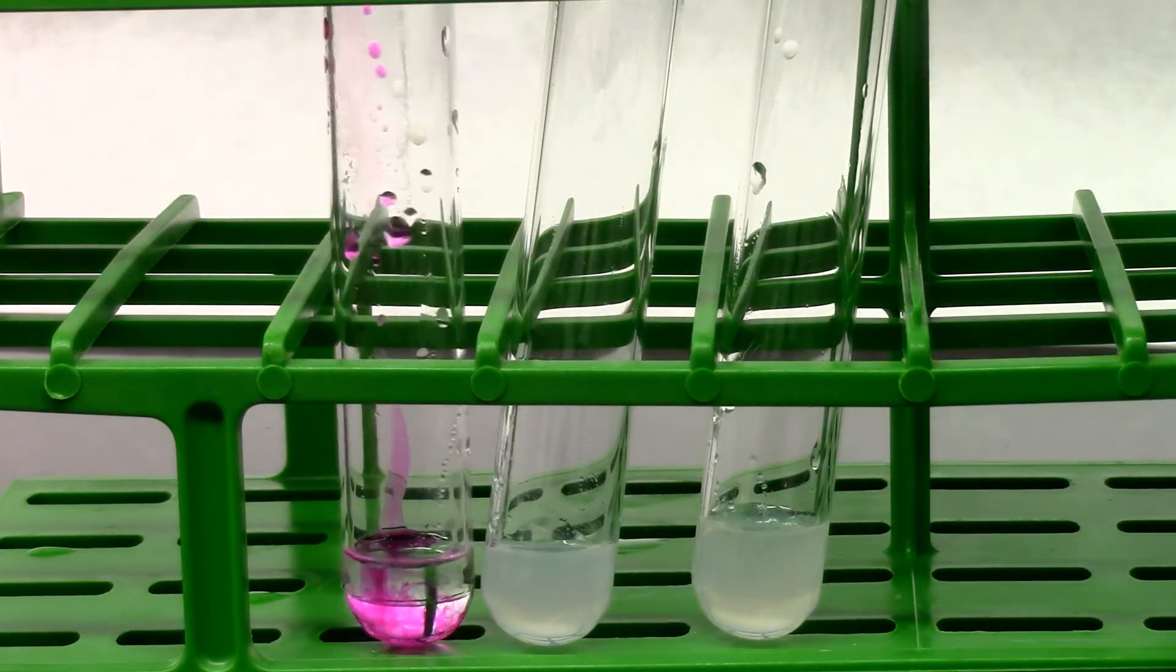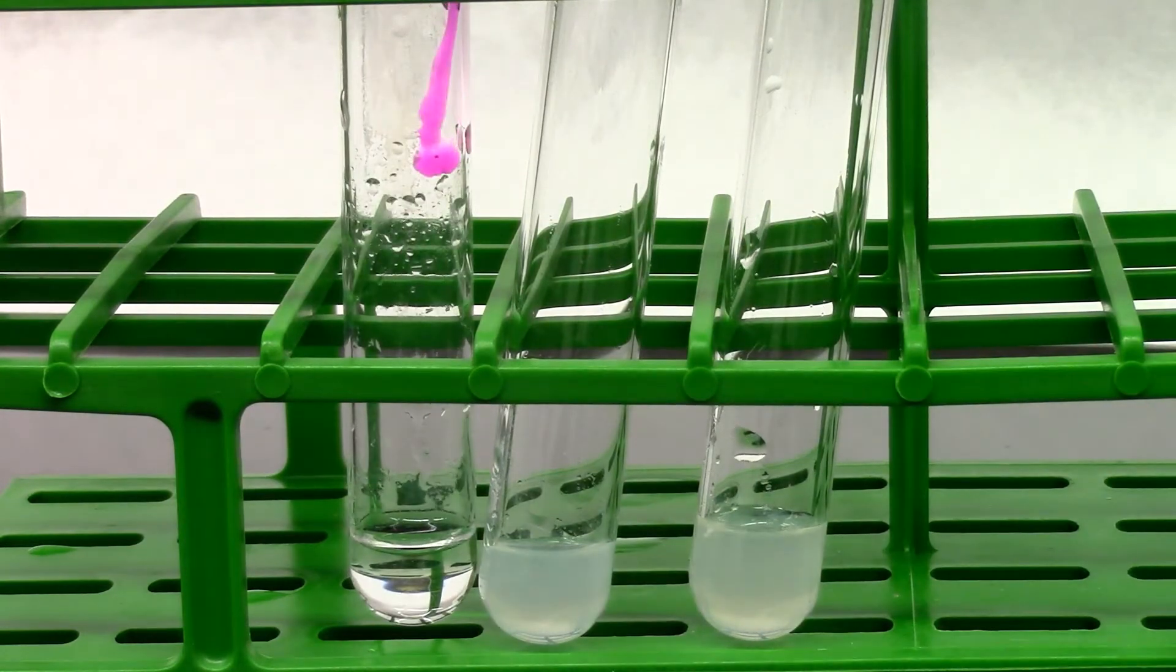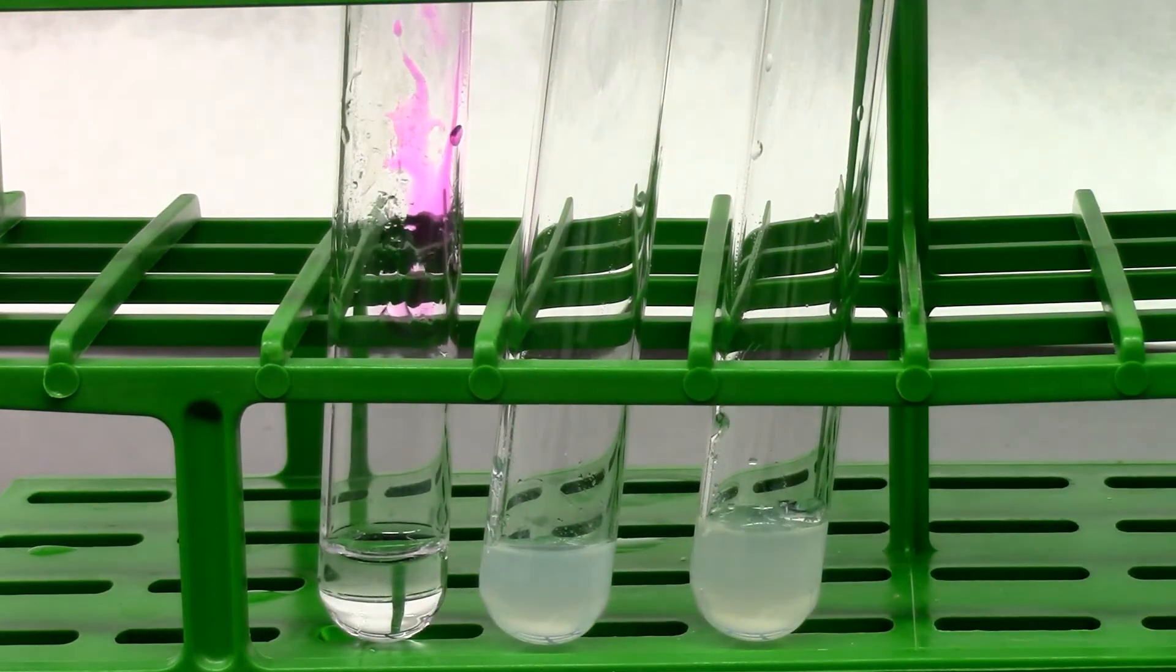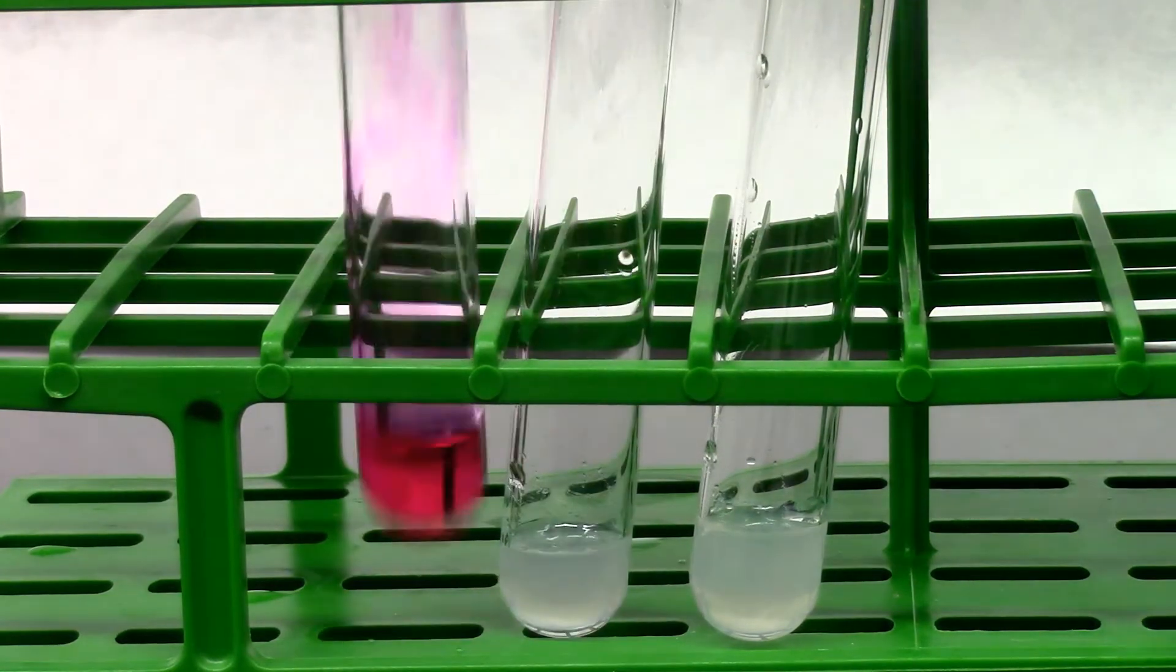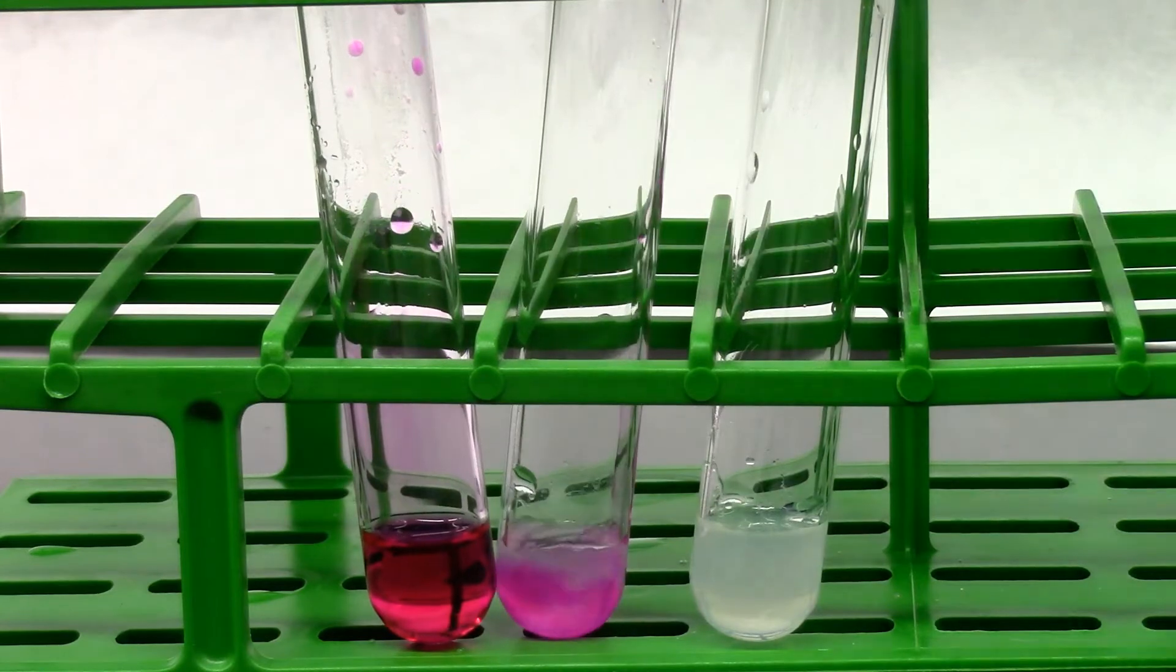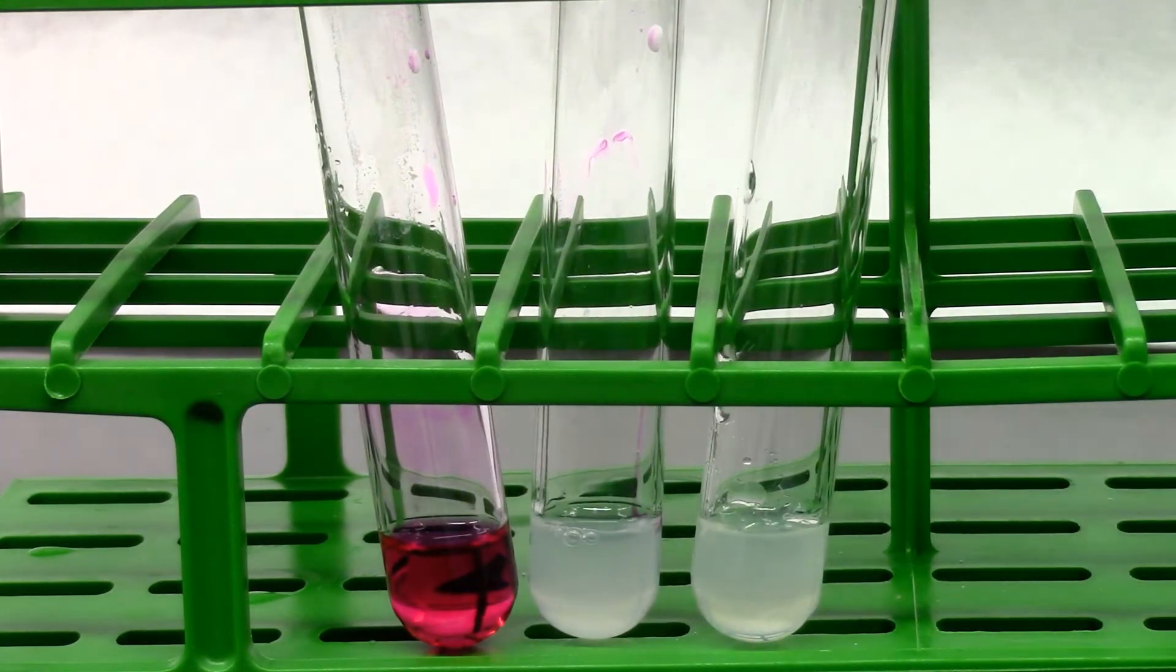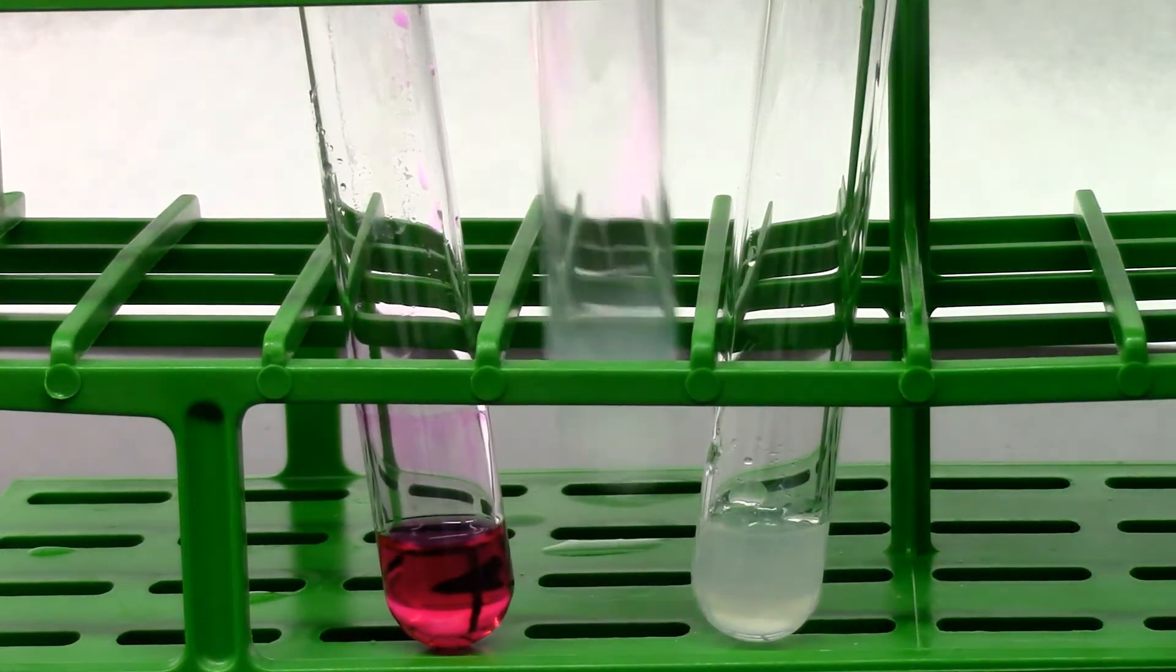So I added two drops. I'll give it a mix. And it disappears. So I'm going to add another drop. It still disappears. So I'll add a couple more drops. And that's a neutralization reaction. The color change will not be permanent until the neutralization point is passed.